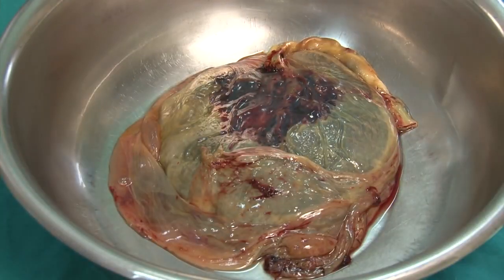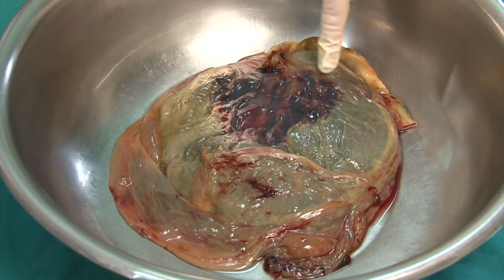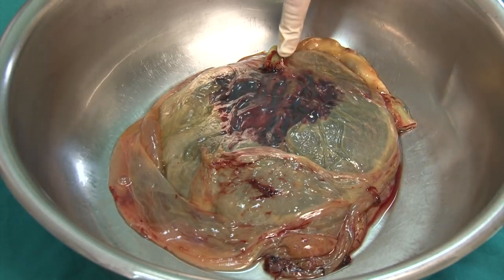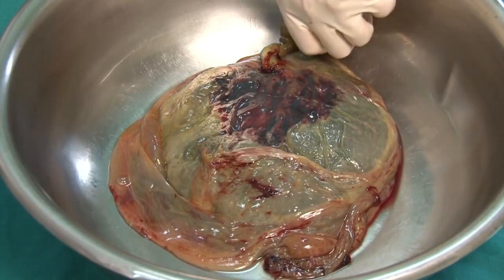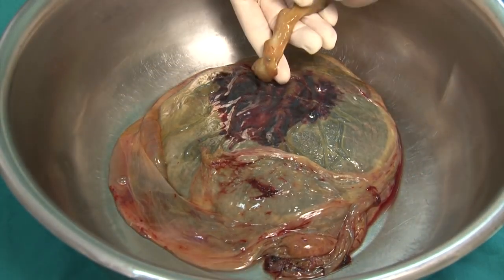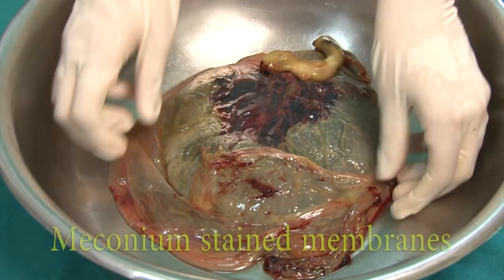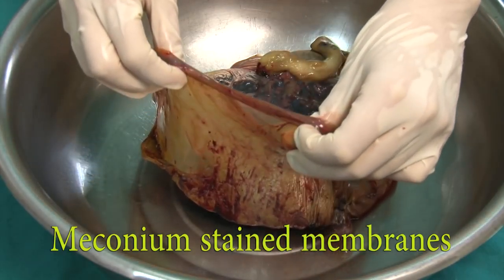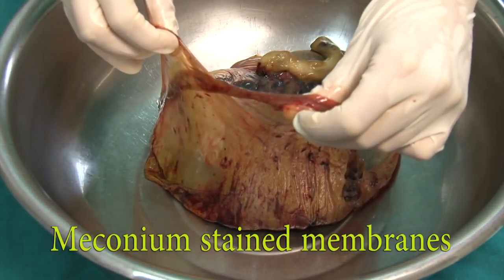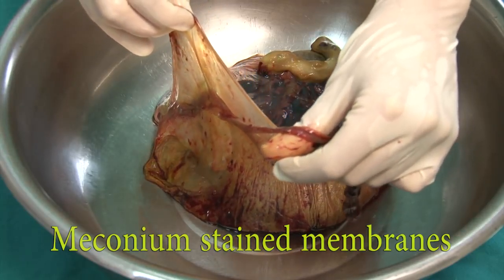This specimen illustrates an example of a subchorionic hemorrhage. Furthermore, the surface of the umbilical cord shows a yellow-green discoloration, which is due to meconium. In the same way, the meconium-stained membranes indicate that the fetus at one stage of the pregnancy must have been under distress, causing the passage of meconium into the amniotic cavity.